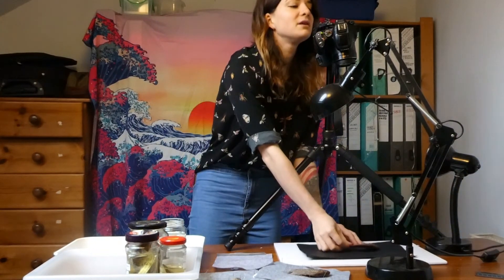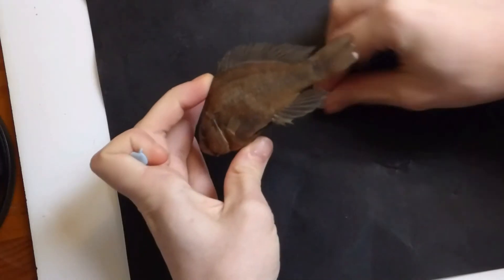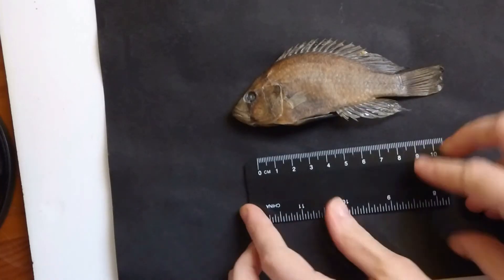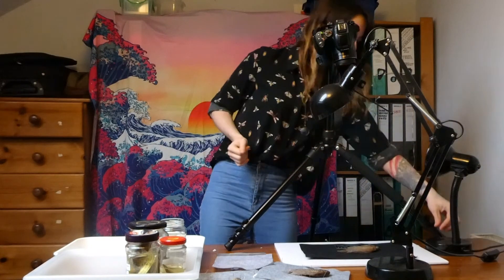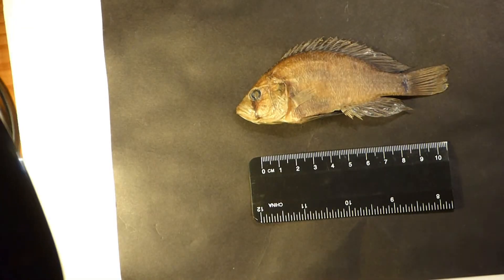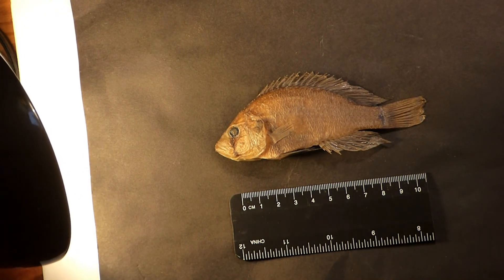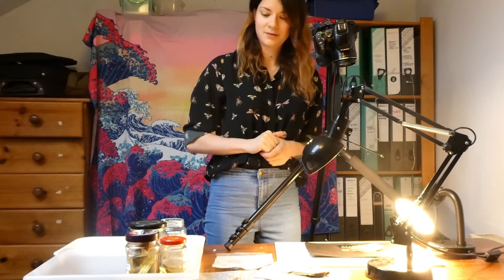Place the fish on the background, making sure it's straight and not at an angle — you can use blue tack for that. In your photograph you're going to need a scale, which we'll use during scaling in the landmarking section. Make sure it's not too close to any of the edges of the image because it can get distorted. Then set up your lighting to avoid shadows on the fish so you can show all the features — just arrange your lamps to avoid all shadows. Make sure to take multiple photographs of each specimen so you can choose the best one, otherwise you'll have to go back and do it all over again.